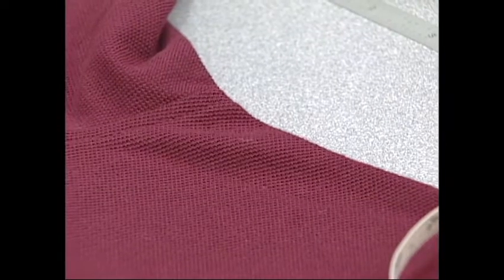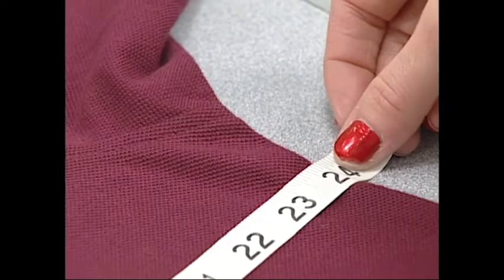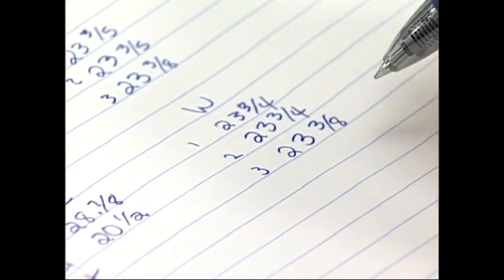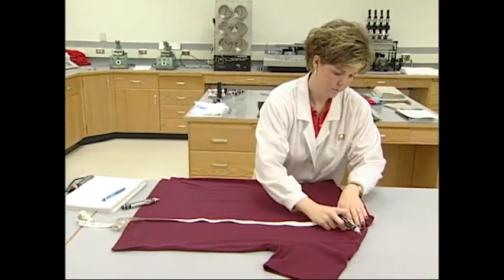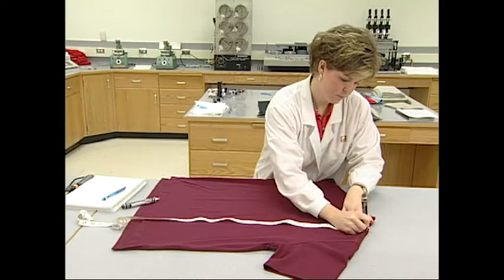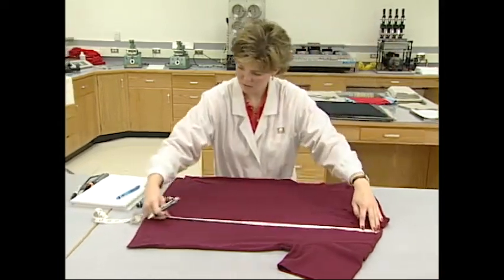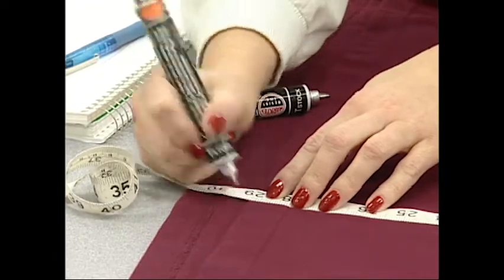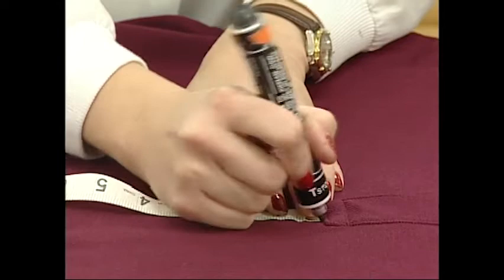The final step in the process is to report the change in dimensions. The values should be reported as an average percent dimensional change, converted and rounded to the nearest 0.1 percent for each fabric direction. Garments are evaluated for shrinkage with a slightly modified test format. With garments, the determination of dimensional change is based on the location of benchmarks, which is important because garment construction, sewing threads, sewing tensions, and trim may affect the fabric and garment dimensions. Therefore, predetermined and agreed upon benchmark locations are used.